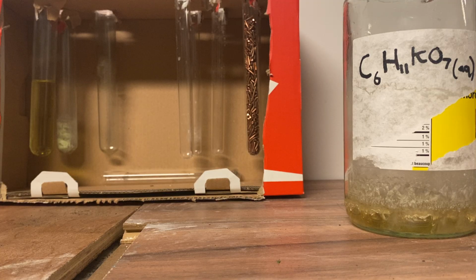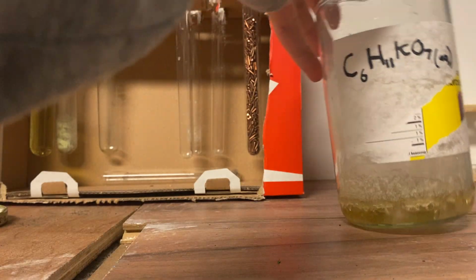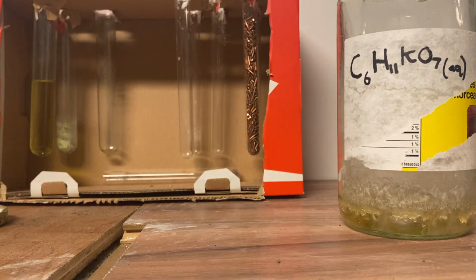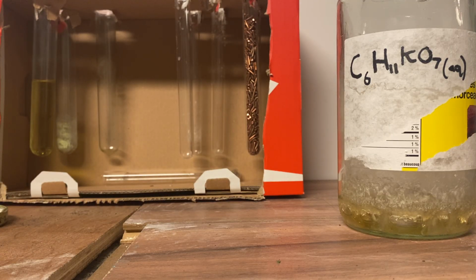which is pretty cool. And if you see over here, this test tube is where I did the experiment. I basically had a test tube with a bit of this stuff dissolved in water, and I mixed it with hydrochloric acid, as you can see over there. That actually makes a mix of potassium chloride and gluconic acid, which is pretty interesting.